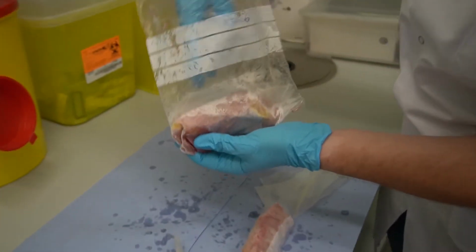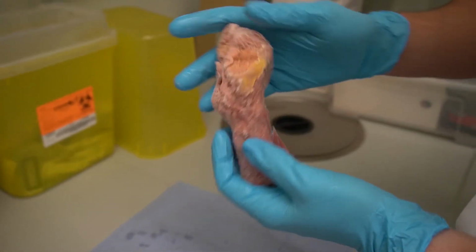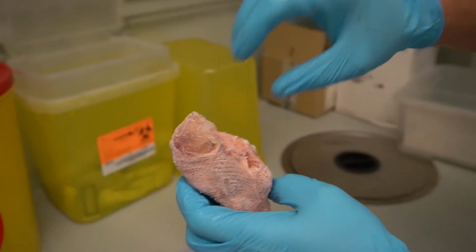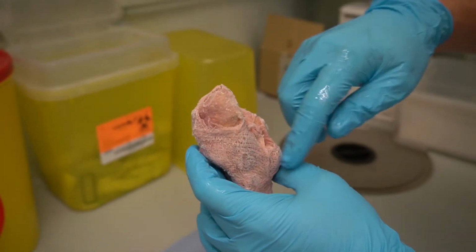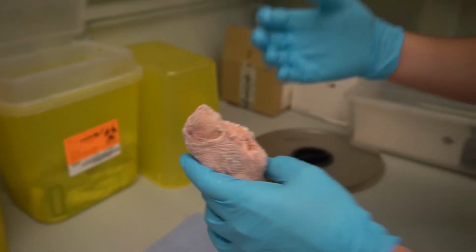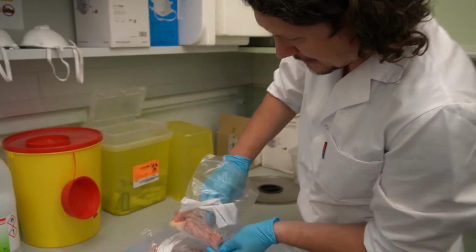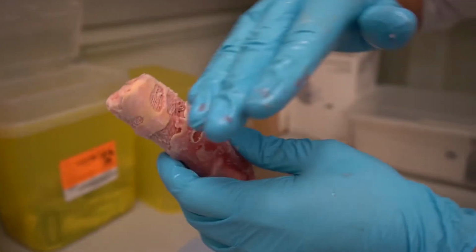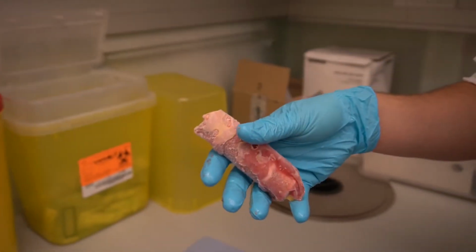Yeah, this is now the proximal part of the human femur, and here you see we cut the neck of the femur with the head. So here we only have the trochanter major and minor, but we do not have the head anymore because this was used in another study. So here we have the diaphysis, which was used in our current project. And we cut slices with a saw nearby.